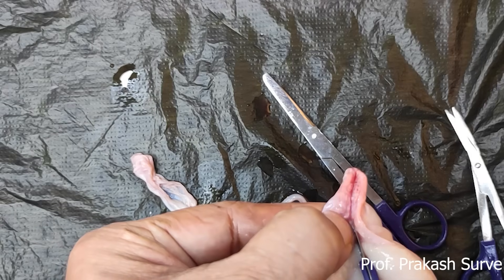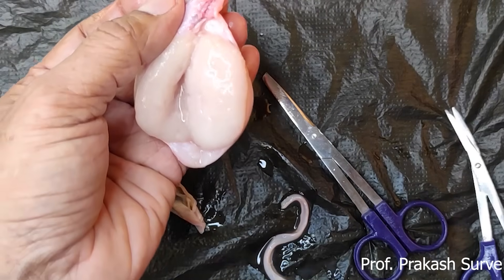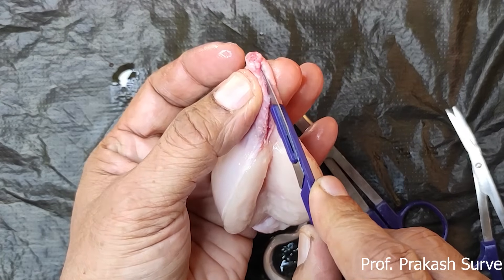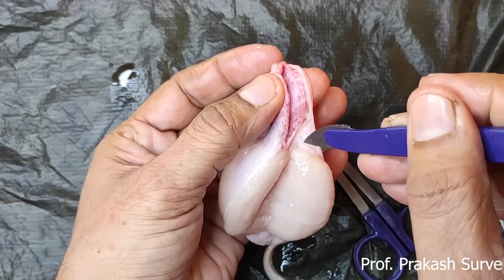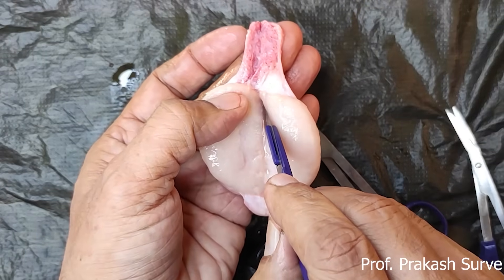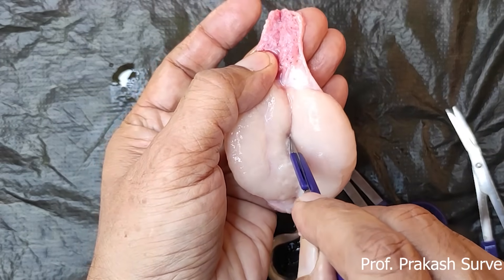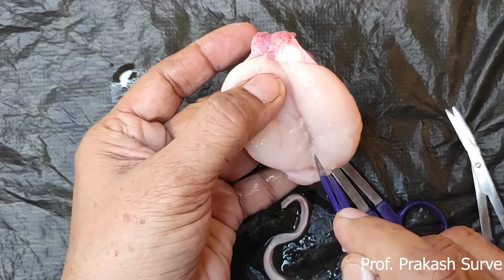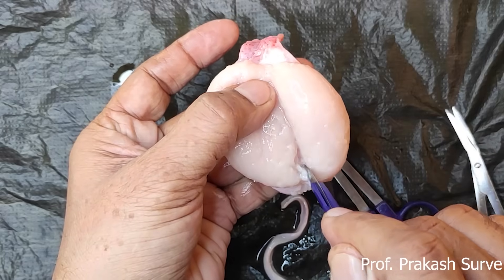Let me take the proper LS. The spermatic cord shows the presence of a number of blood vessels, nerves, and artery, which goes down and gives nourishment to the developing sperm. So here we have got the LS of the testes — the mammalian testes, the LS of the testes of the goat.